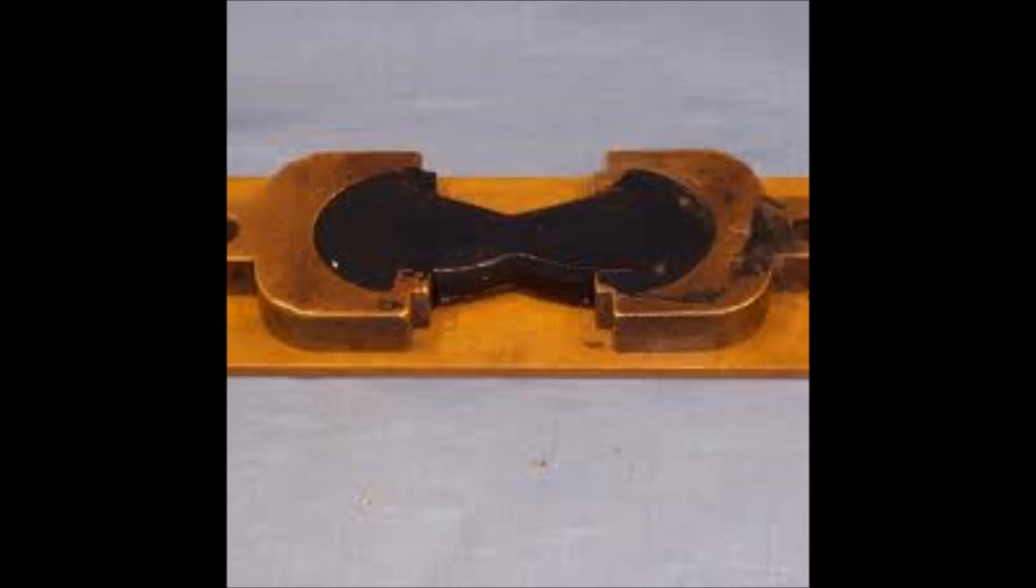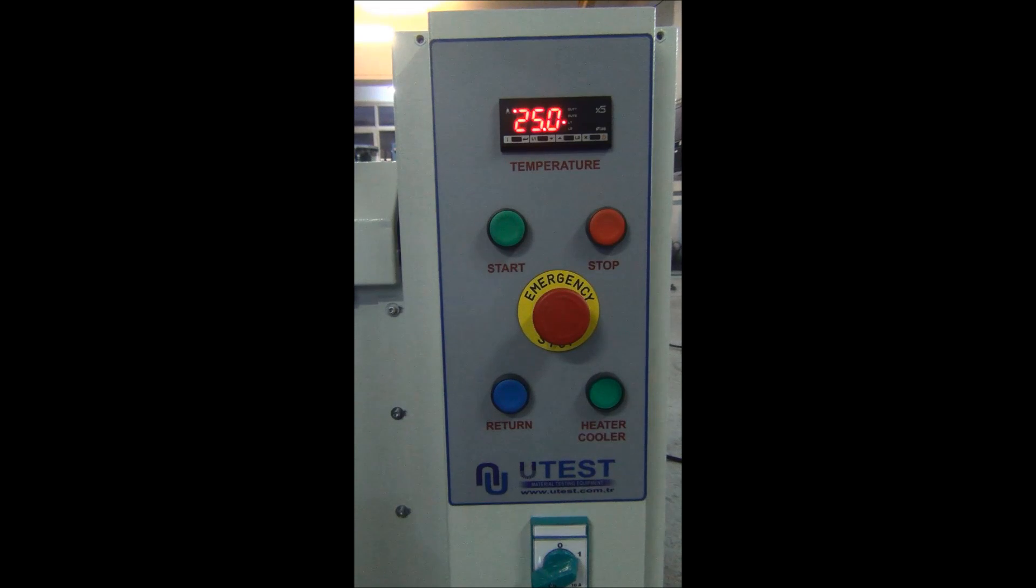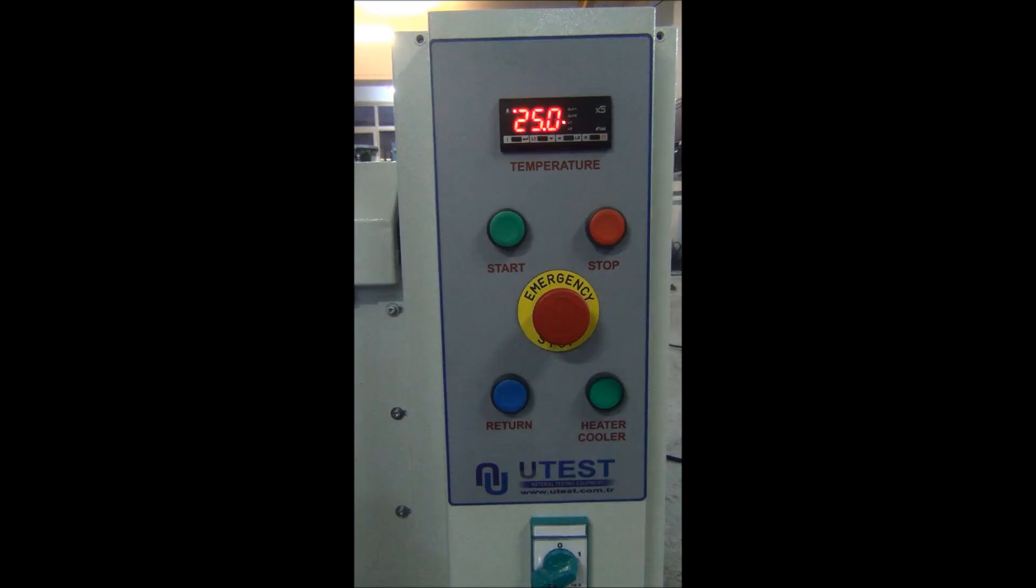Remove the molds from holder and place them to test area. If necessary, start and stop the device to make a small tension on the sample.